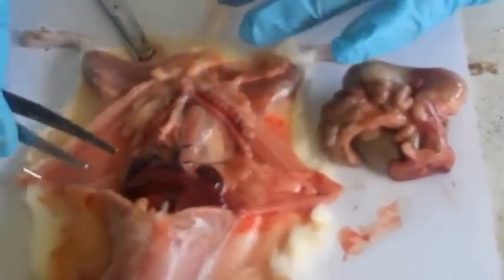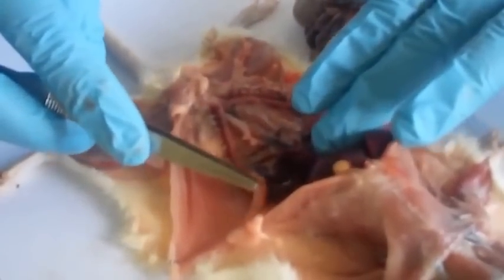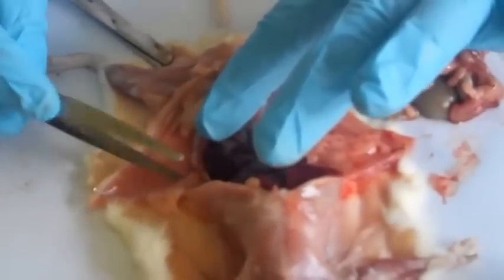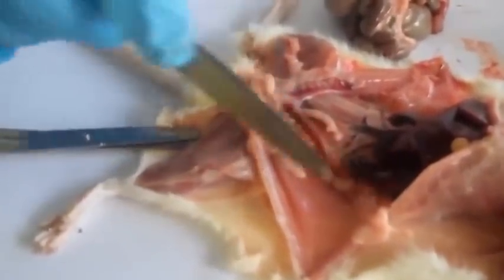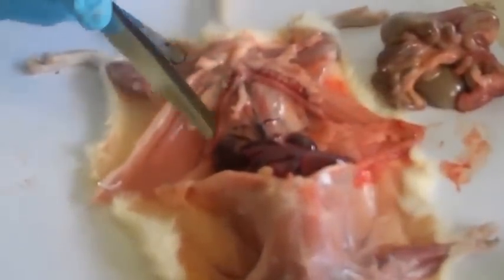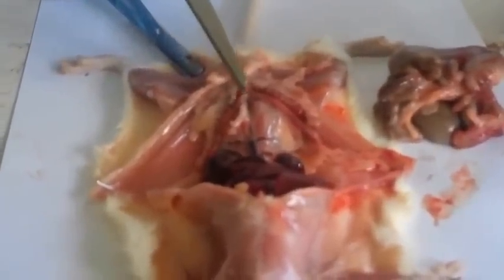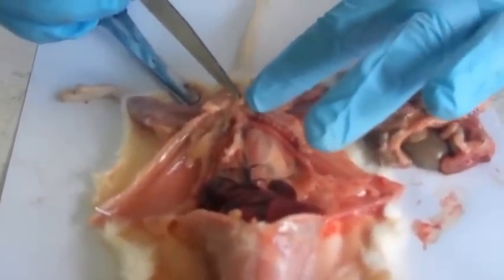Yeah, so this is the left ovary. You can see something that's circular and as if coiled. That's the left ovary. Then we have the oviduct, just the small little tube that connects it to this other part. That's our oviduct. And then we have the uterus. This is the uterus that has got the supply of blood vessels to it. And then we have the vagina. This is the vagina, this curved part that connects to the clitoris.